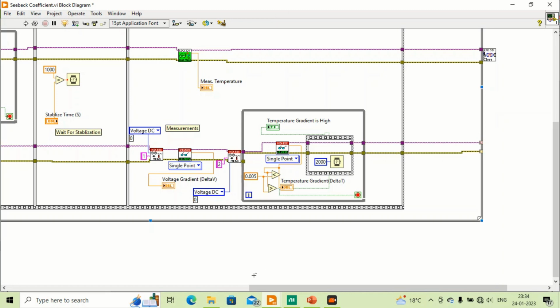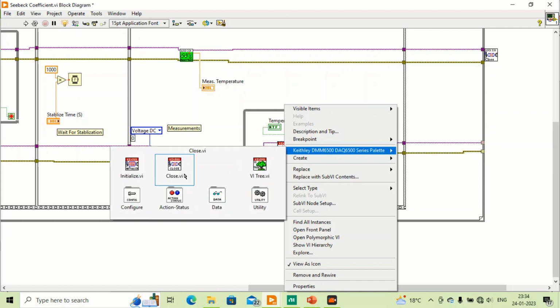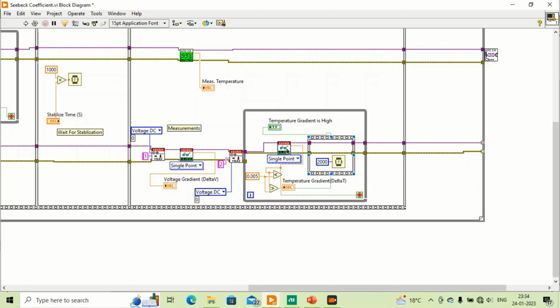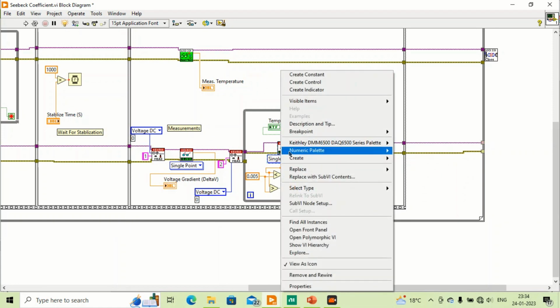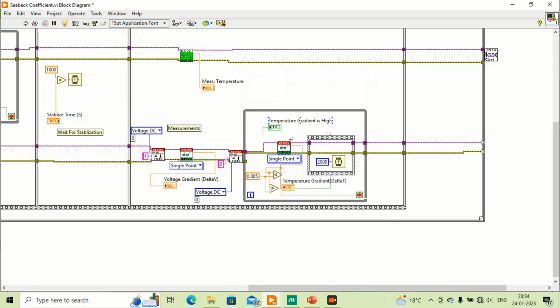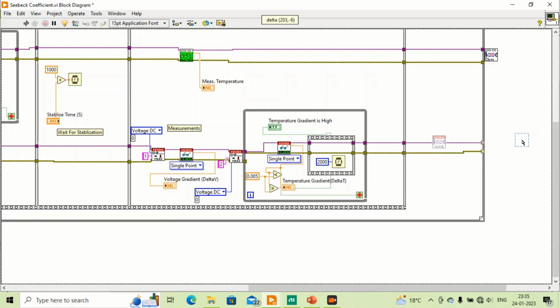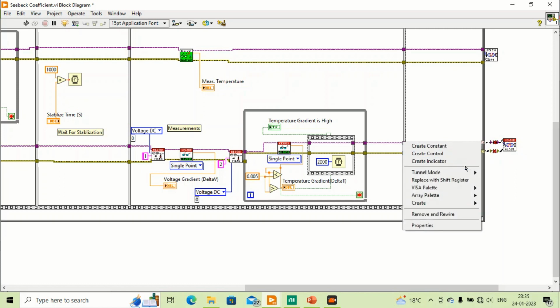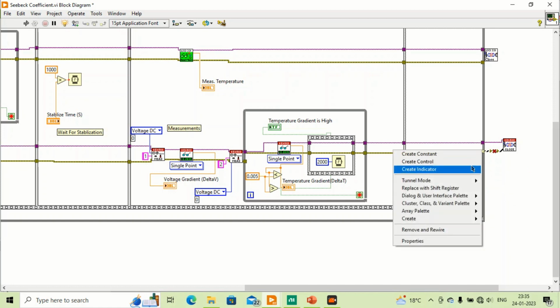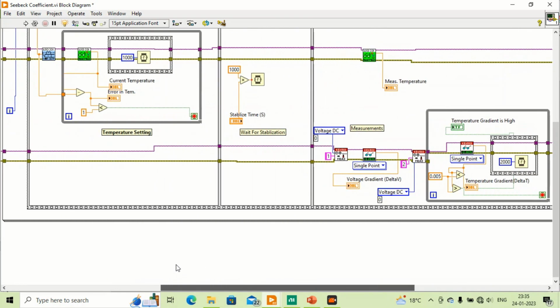And again we will close this one also. Close VI. Where is this close? Oh my god. It should be for the lost value. Okay, so now the programming part is complete. Now we have to save data.